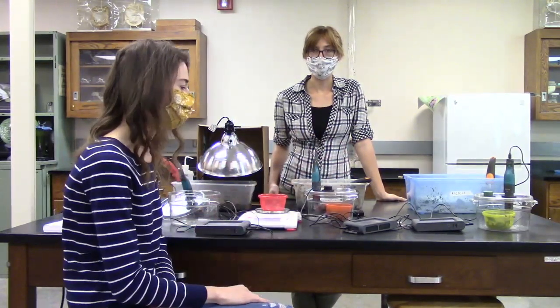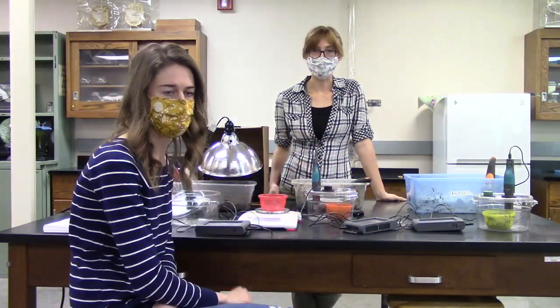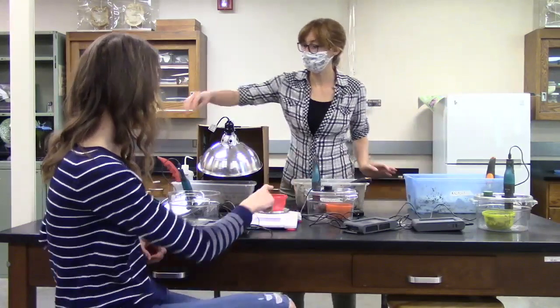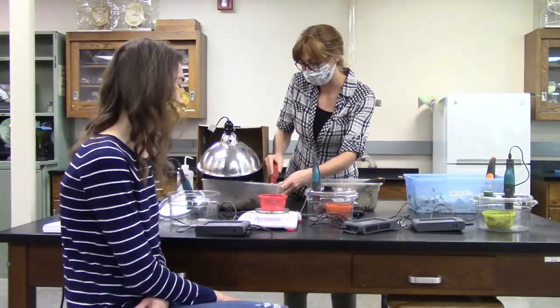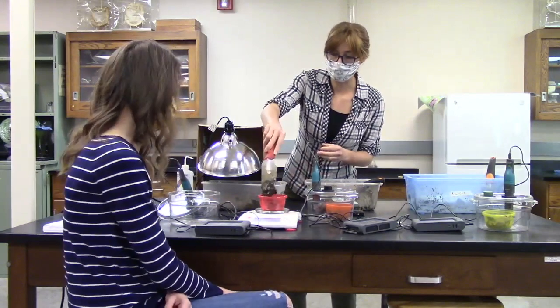So now we're going to get started, and we're going to let them all run for 5 minutes. We're going to be recording data on each of these CO2 sensors for 5 minutes. So we're just going to get those all rolling at the same time. Lindy's going to get our final one weighed out here. We're doing 100 grams of soil for each of these, plus or minus 1 gram. So we don't have to be perfectly exact, since we're using a pretty good portion of soil.